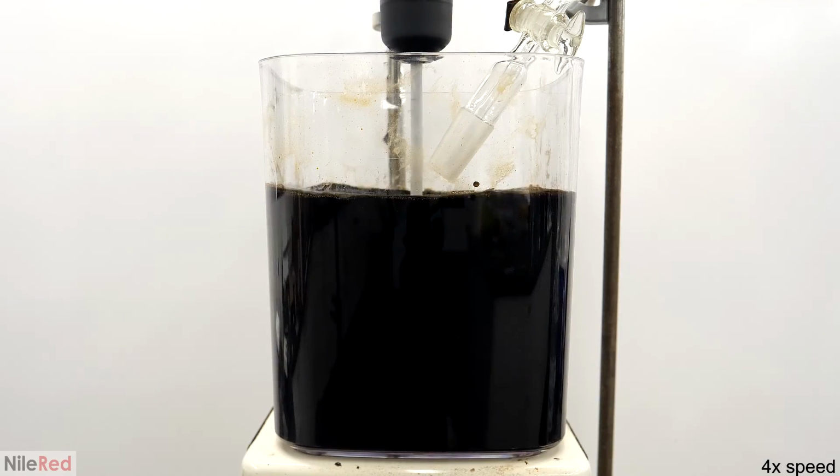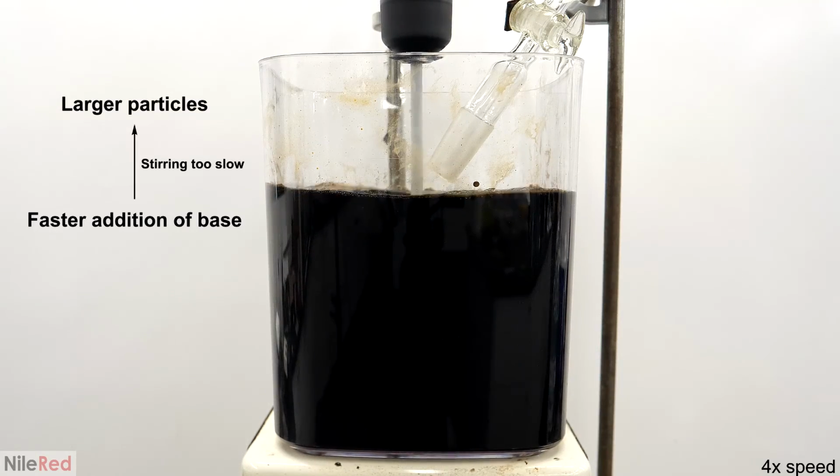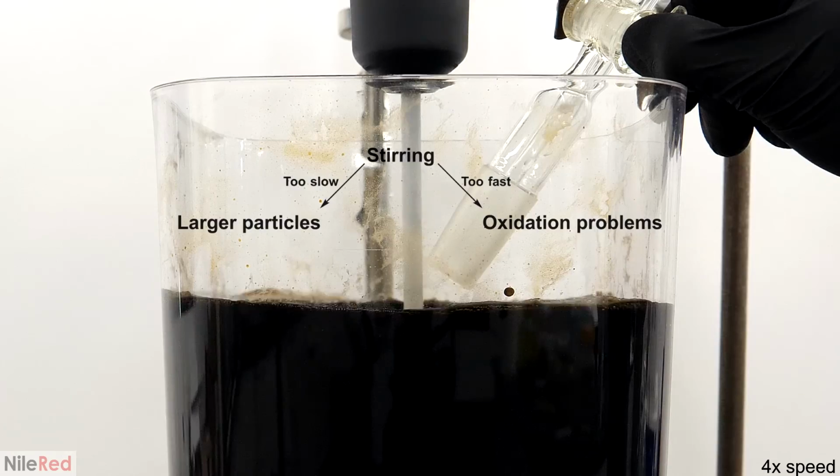The speed that I added the base at also affected particle size, but this too was dependent on the stir rate. A faster addition could lead to smaller particles. However, if the stirring weren't fast enough, it could cause larger ones to form instead. So basically, if I stirred it too quickly, I might get too much oxidation, but if I stirred it too slowly, the particle size might become too big.